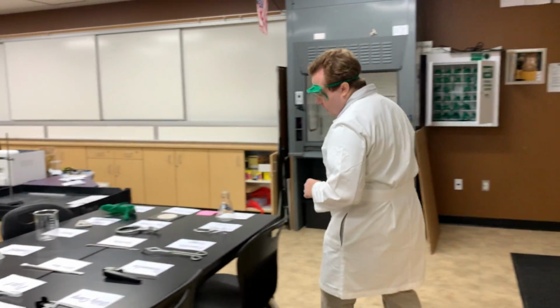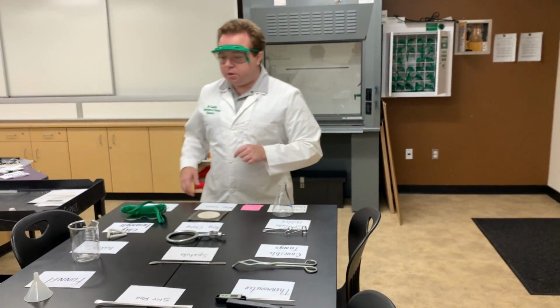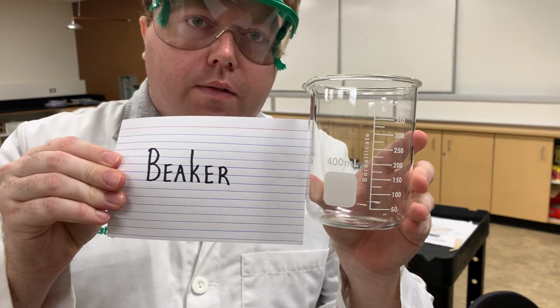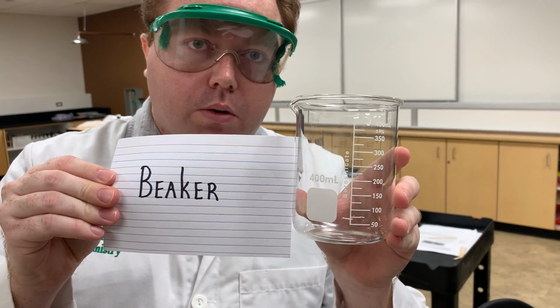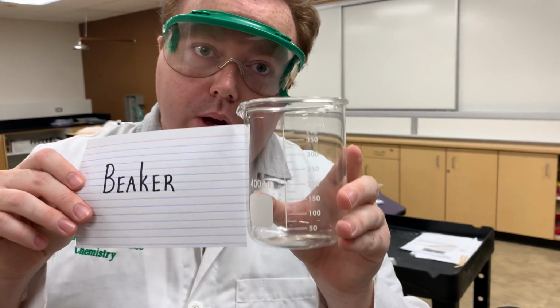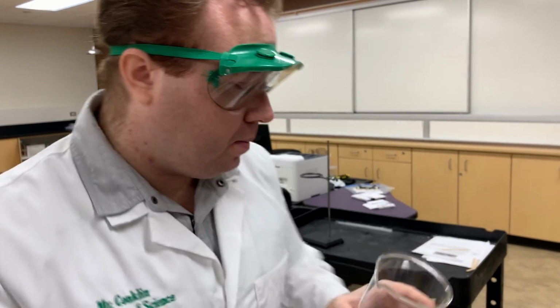Let's come on over here, and next we will look at the beakers. The beaker, ladies and gents, is what we use to transport liquids in. A very important thing about the beaker is that we never use it to measure liquids. Even though there are graduations and measurements on the side here, they are not scientifically accurate. So don't ever use one of these to measure liquid. Just use it to transport liquid.